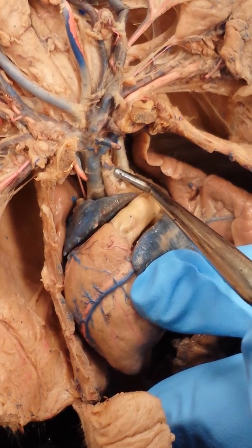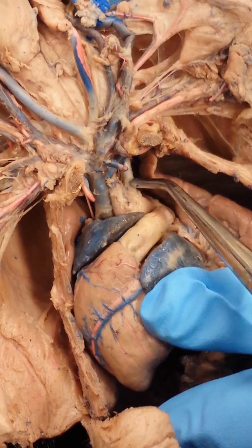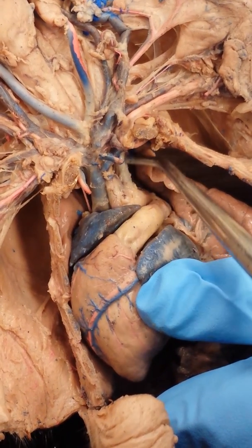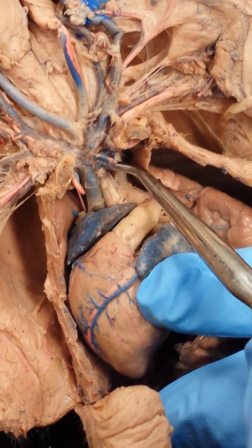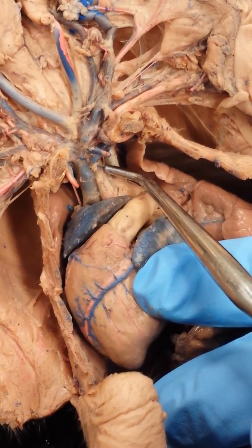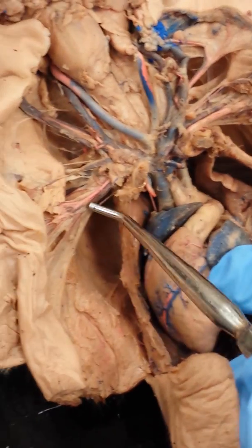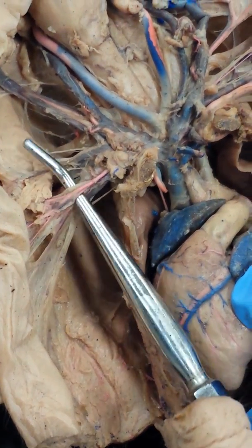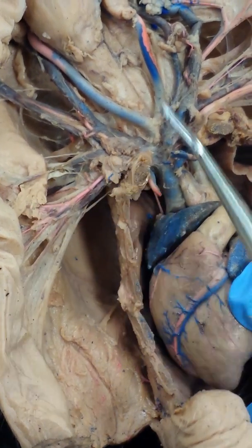The first one, kind of towards the middle of the body, is the brachiocephalic trunk or artery, and the one more towards the left side of the pig is called the left subclavian. Now coming off the brachiocephalic trunk, we have the right subclavian, but we can't see it. It's not underlined in your notes. And then we have the right axillary. So what you want to know is that when the artery passes the ribs, or even the vein, it's called axillary. Okay?